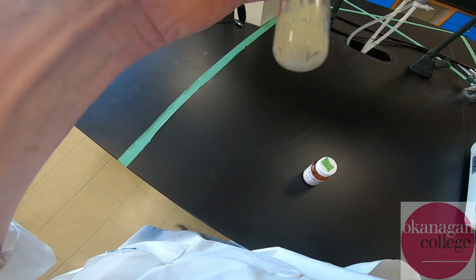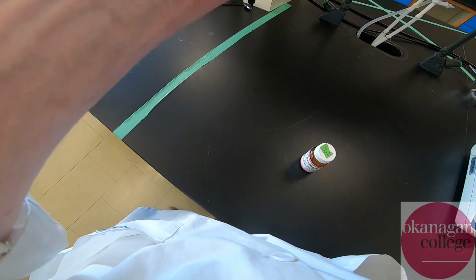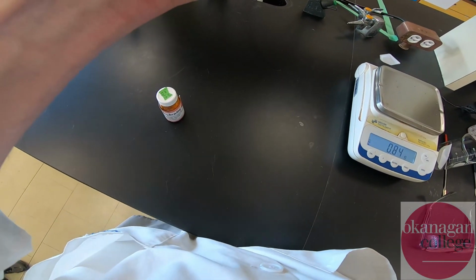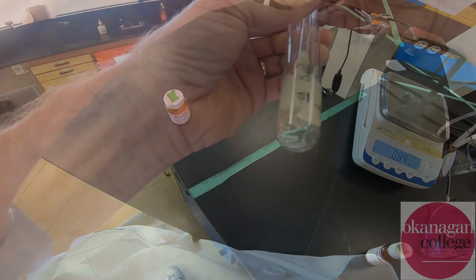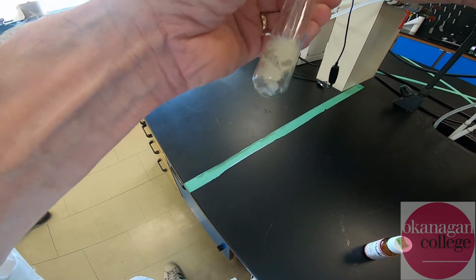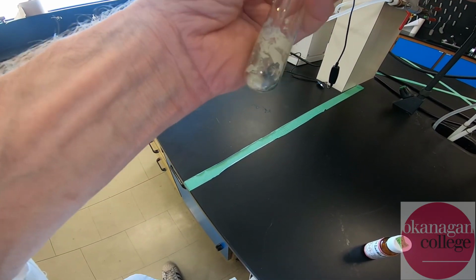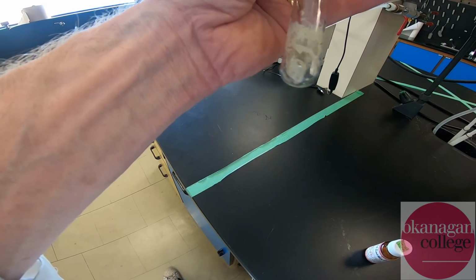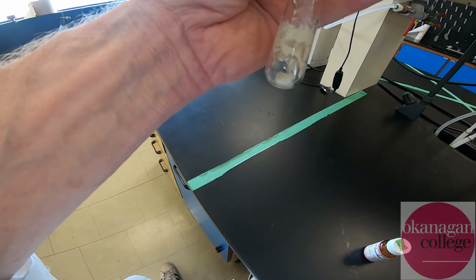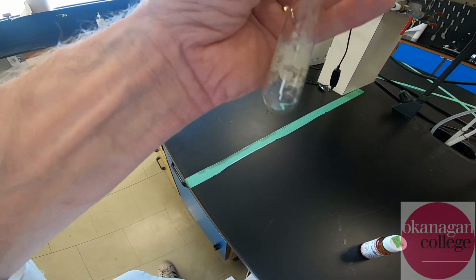Okay, bit of time travel. We're another 2 or 3 minutes down the reaction time. We're getting close to the end of the reaction. You can see that this material has now turned into a really thick paste. Okay, another 2 minutes in, and we have got a nice thick paste of material. It's very gummy in consistency. Give it another minute or so, and then we're going to add some HCl to finish the dehydration and end up with our final product.